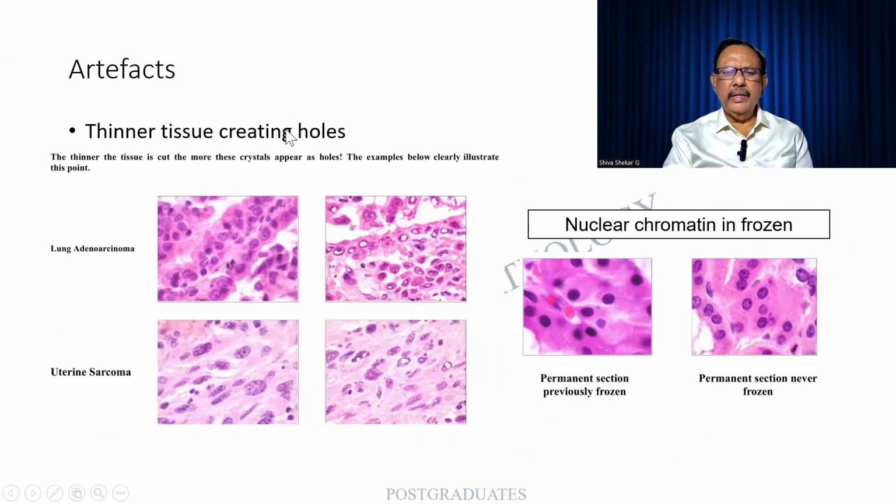The thinner the section, the greater the holes or artifacts. Sometimes we think only thin sections are needed. Here you find that there are too many holes which are not found in the normal one. Similarly, in connective tissue also, there are too many holes in the nuclei which can be artifacts. Look at the nuclear chromatin in the frozen one. This is a permanent section in which there is a vesicular nucleus, whereas here it becomes artifactually hyperchromatic.